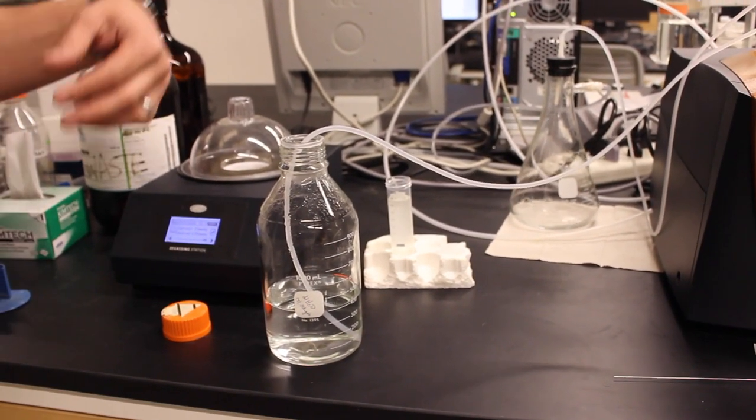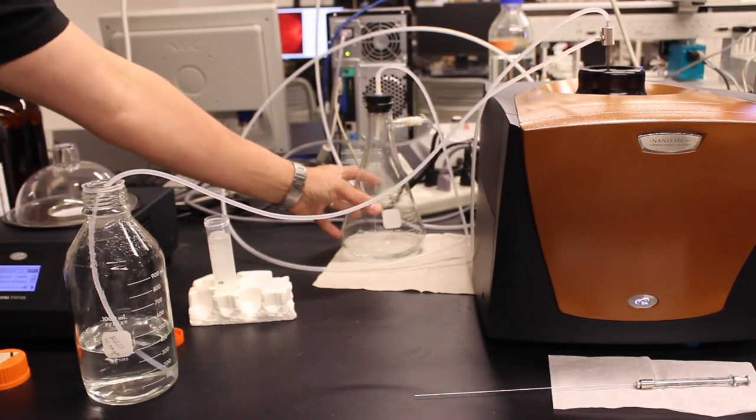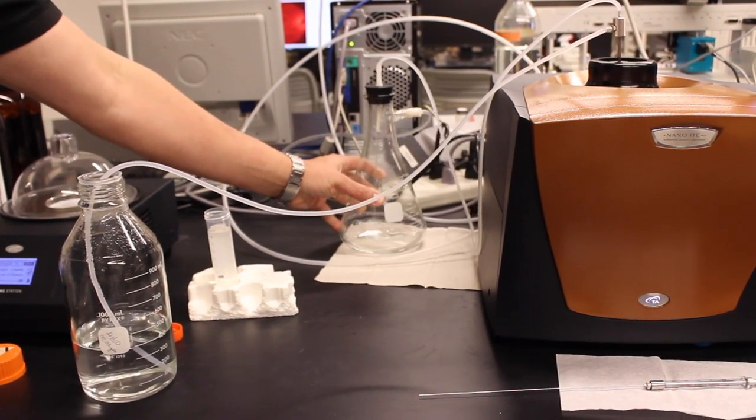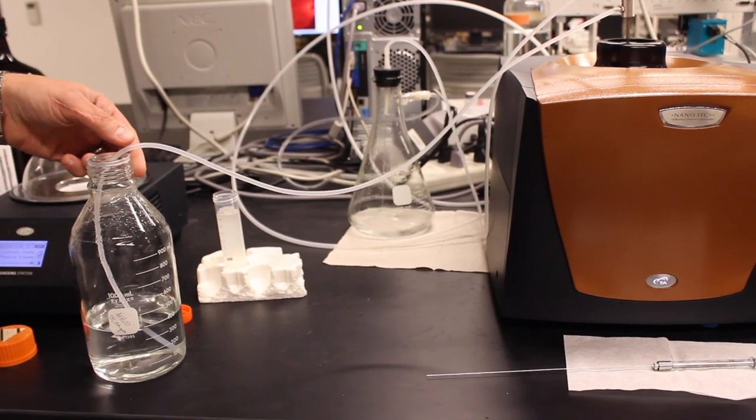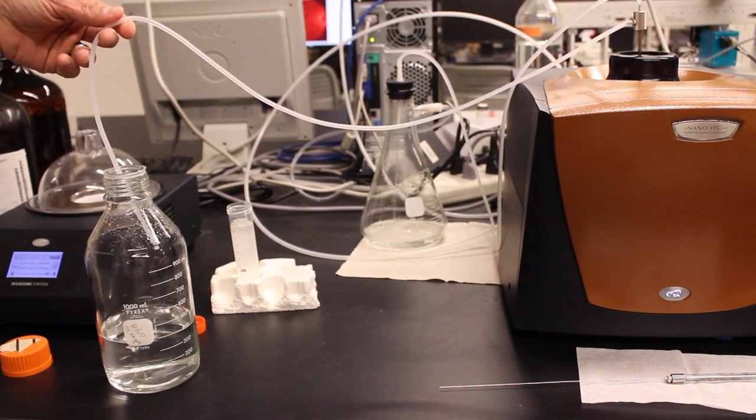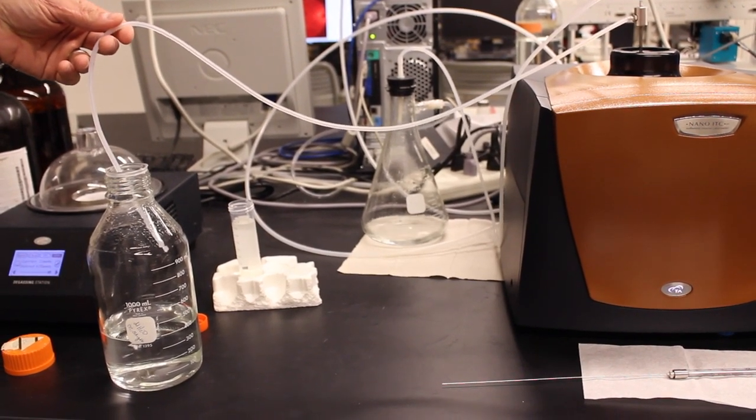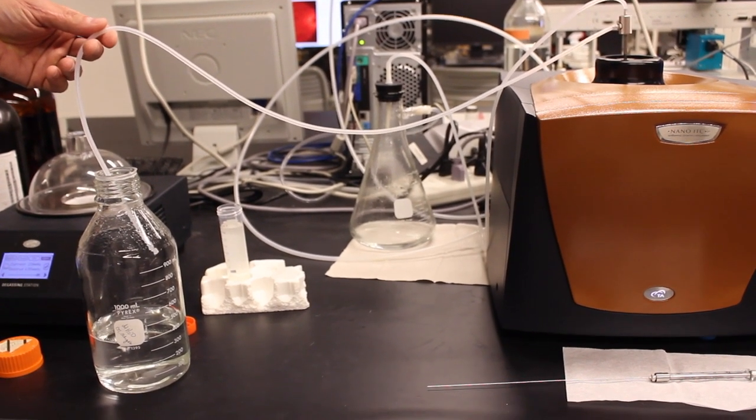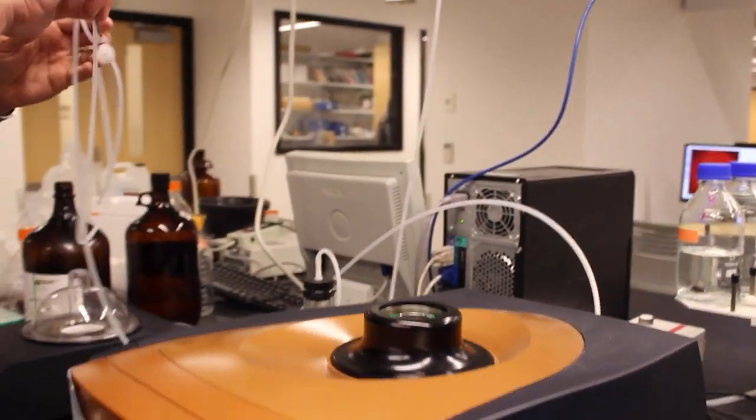Typically, it will keep pulling liquid through because there's a considerable vacuum in this volume here so it's often easiest to remove the tube and it will suck air through to finish releasing the vacuum. So now we've removed the cleaning wand.